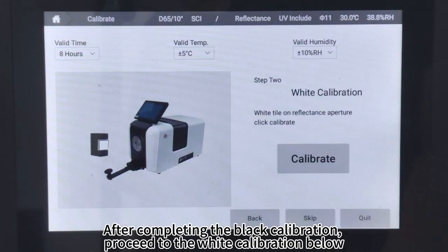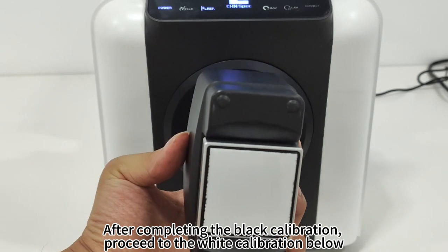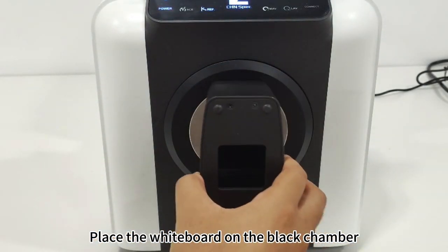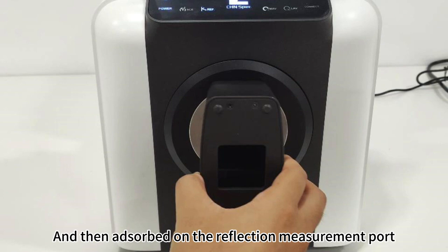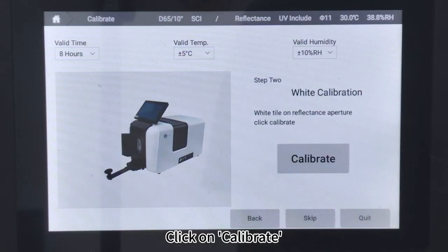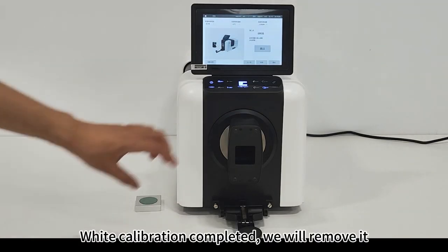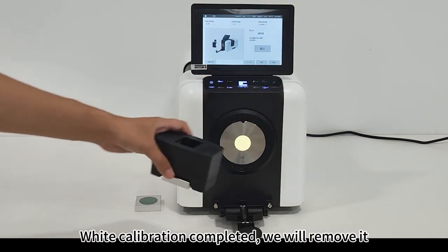After completing the black calibration, proceed to the white calibration below. Place the whiteboard on the black chamber, and then attach it to the reflection measurement port. Click on Calibrate. White calibration completed. We will remove it.